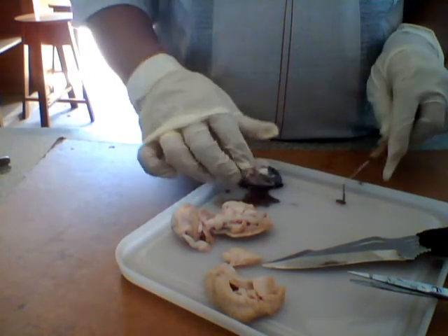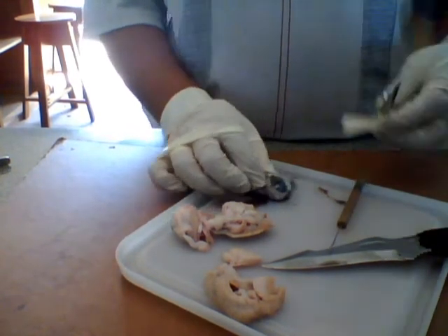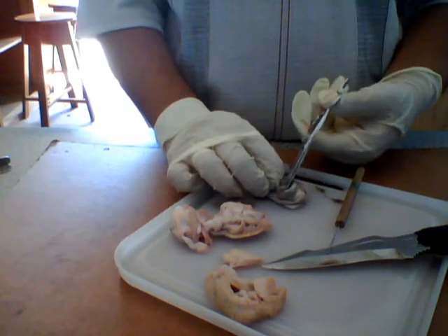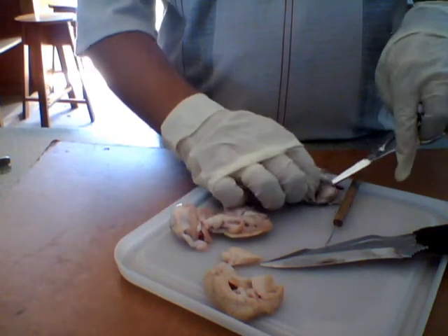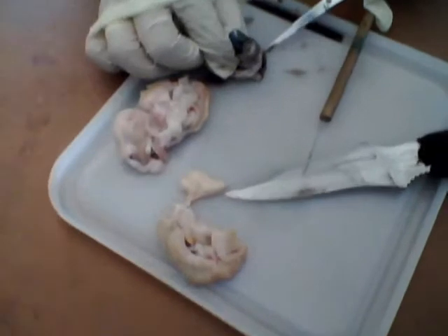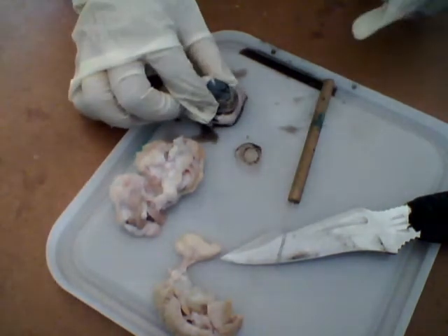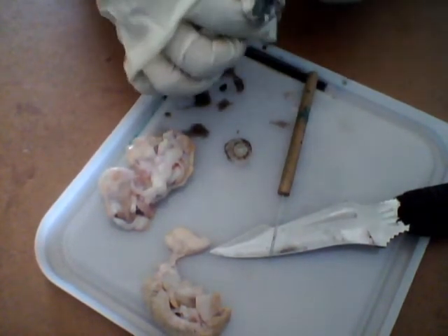Okay, see the fluid coming out. At this point you need to be careful because we do not want to damage the lens. Here it is coming — see right there, this is the lens. If you want to see inside of it, all you need to do is remove the top part.